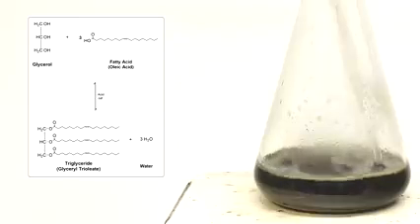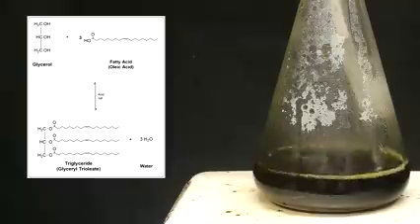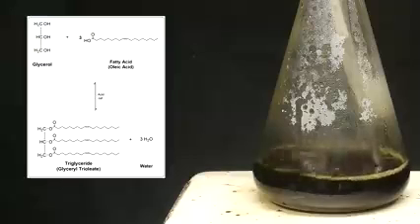So in theory, this is the reaction that should be going on. In the presence of an acid catalyst, the glycerol reacts with three fatty acids to form the corresponding triglyceride and water as a side product. The one unfortunate thing is that acid-catalyzed ester formation is an equilibrium reaction. So the water that forms can go back and hydrolyze the ester and take the reaction in the reverse direction.